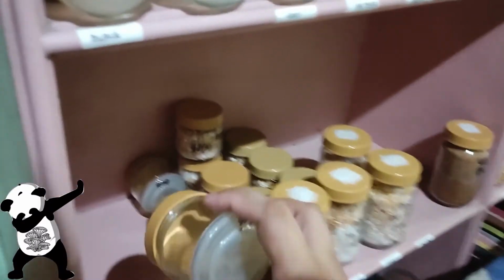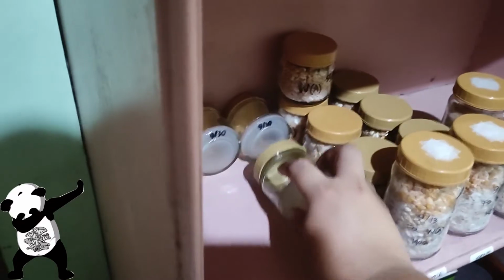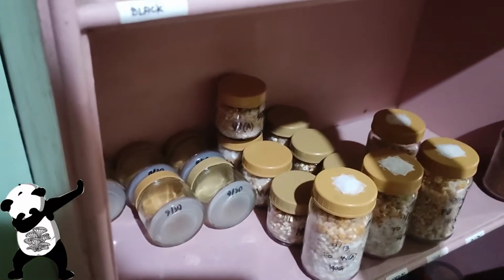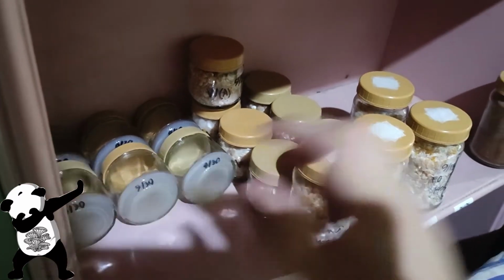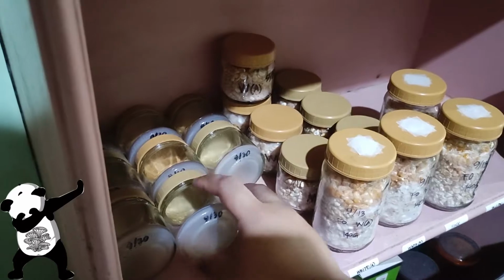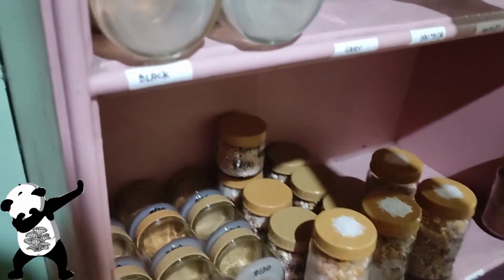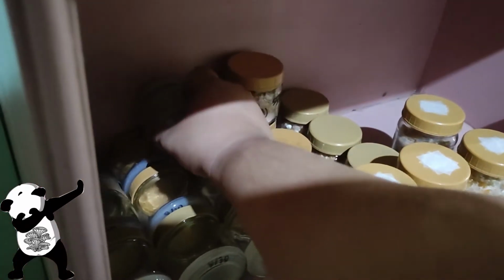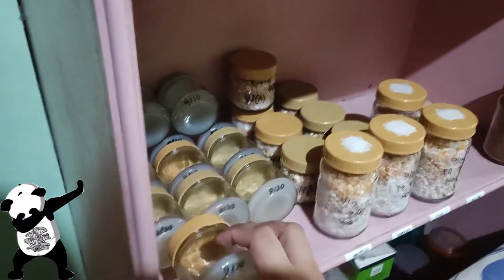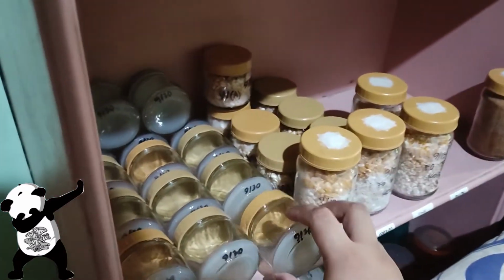Yeah, so that's perfect. So all of the plates that we have are clean, and now I'm actually doing some inoculation because I've been running out of PDA, especially the reserved PDAs that I have. So it's a minor setback. It really takes around 2 weeks again. That's why the thing that I have to do is wait up until I verify that they are all clean, wherein usually I just wait 4 days before using them, but now I have to wait 9 days just to be sure. So that's it.